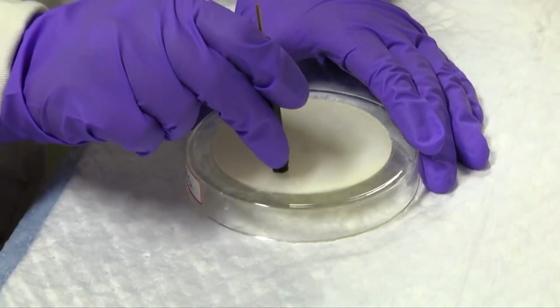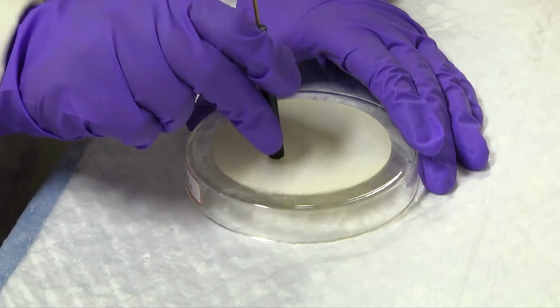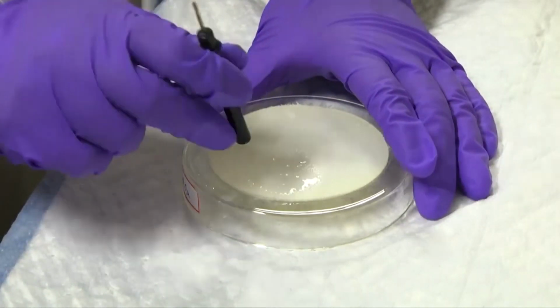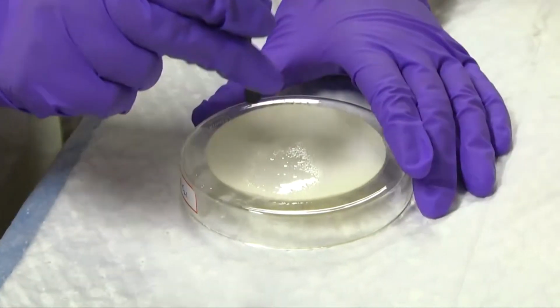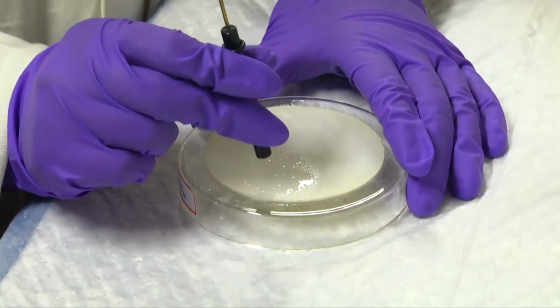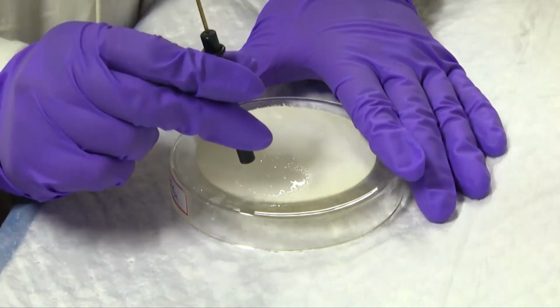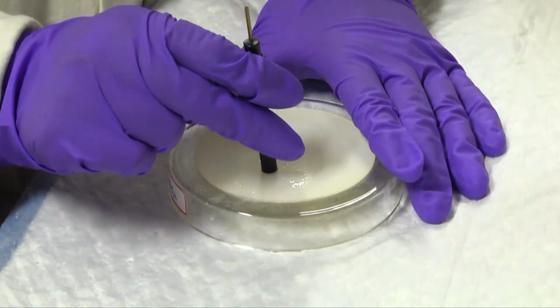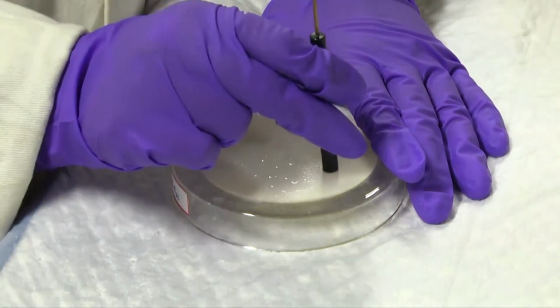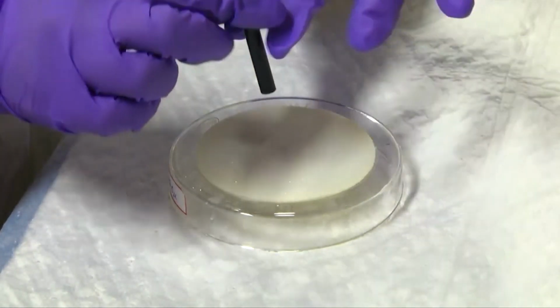We must keep in mind that we should not press the electrode tightly onto the surface. It should be very gentle. Now the slurry is being made. We need to hold the electrode as a whole like this, but press the electrode very gently onto the surface of the micropad, and then we'll slowly make a figure 8. As you can see, slowly we are making 8.